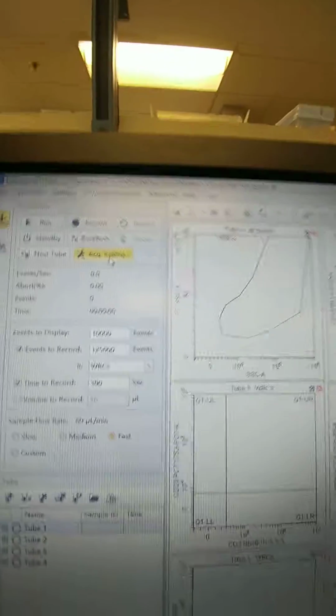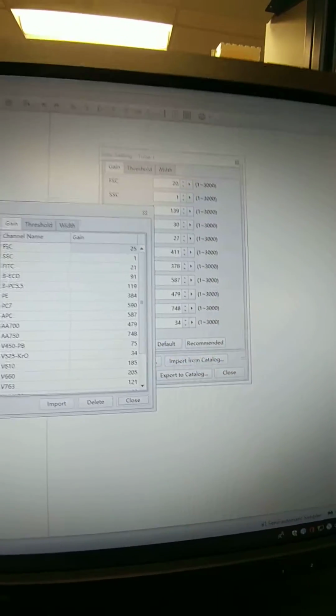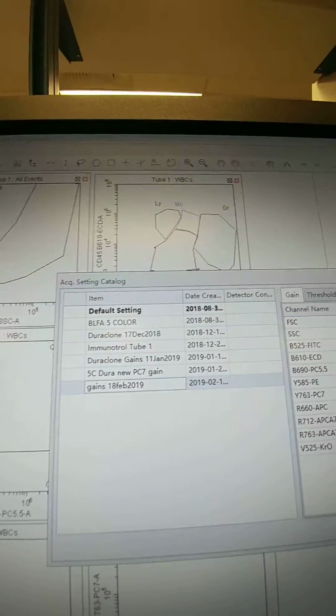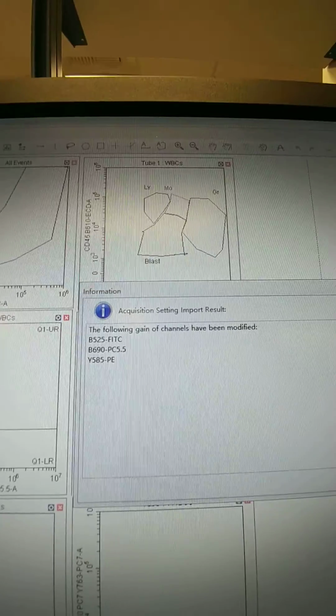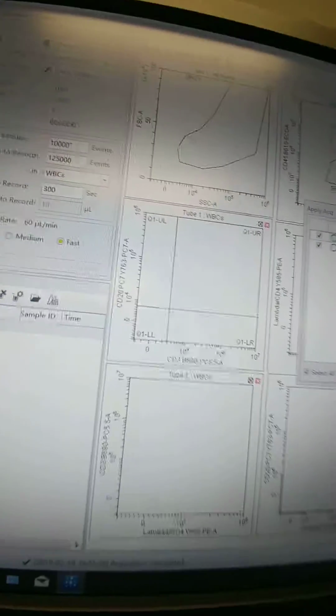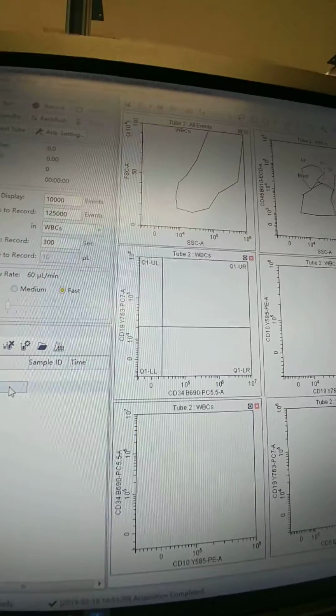But now you can come up here, click Acquisition Settings, and instead of recommended or leaving what it's set at, we're going to import from catalog. This is what I named the ones we just saved, we're pretending those are the ones he likes. So click that, import those. It's telling me you're changing the gains of these three. That's what I expect, so okay. Close that. And then you can either come down here and right click and do Apply Acquisition Settings. Well, it's only going to let you apply to tubes 2 and 4 for some reason. So I'm going to do this the long way.